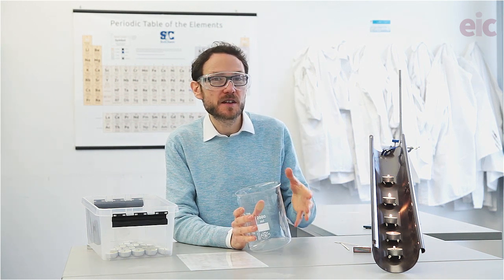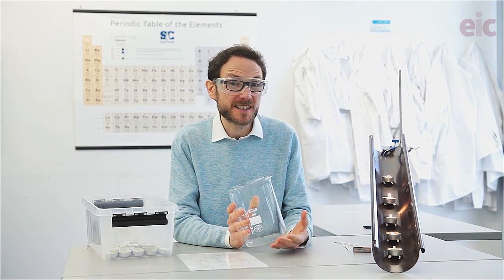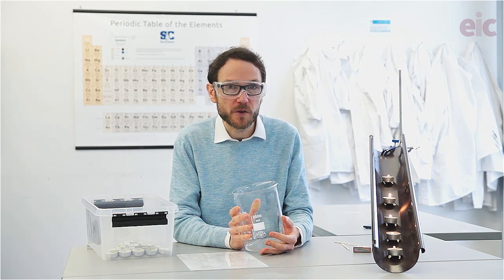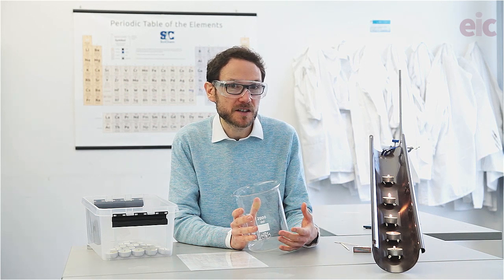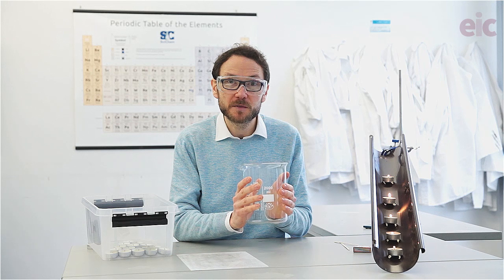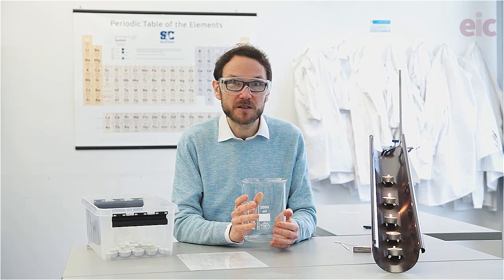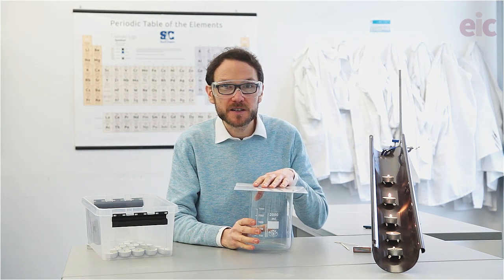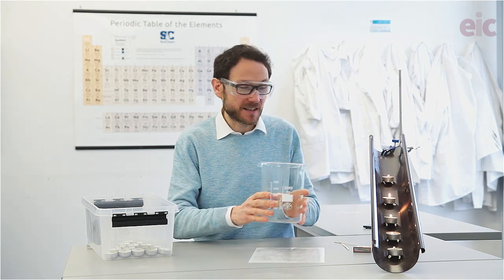We can also try to demonstrate the same kind of effect using a section of guttering. One of the nice things about having a simple demonstration is that you might want to use it more than once at different year groups, so having a different way of showing the same effect can be handy. I'm going to create another batch of carbon dioxide in my beaker and see what kind of effect we get running it down the guttering. So here we go — a nice big beaker of carbon dioxide, and let's see what effect we get down this guttering.